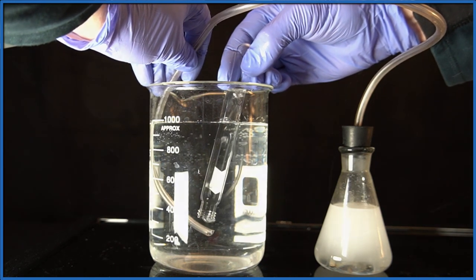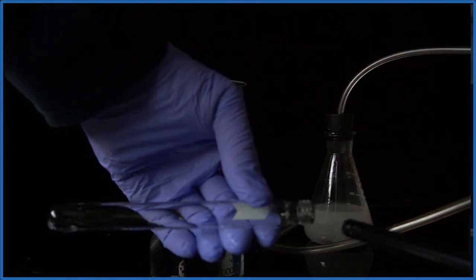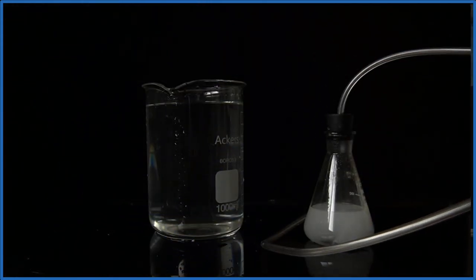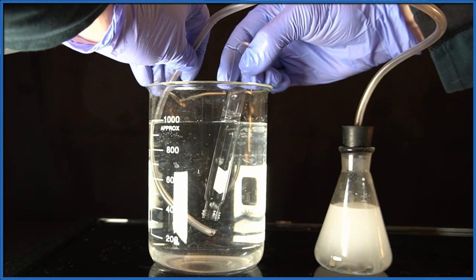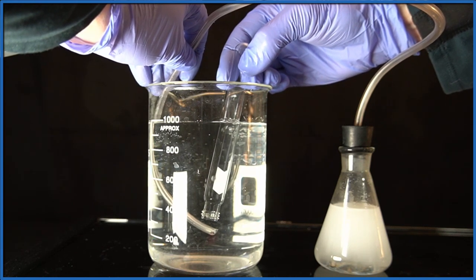We take a flame and we light that, and you can see that we have that reaction there, the hydrogen gas ignited. Oftentimes when you do this you'll get kind of a squeaking noise, like this.